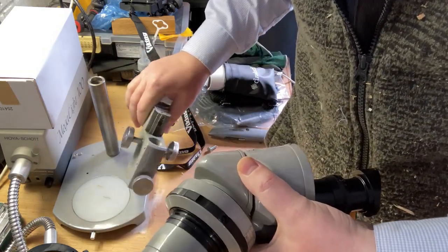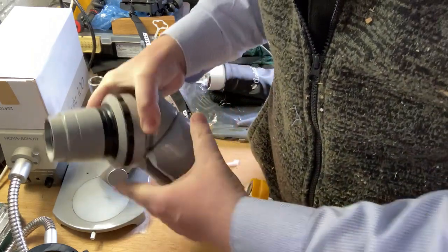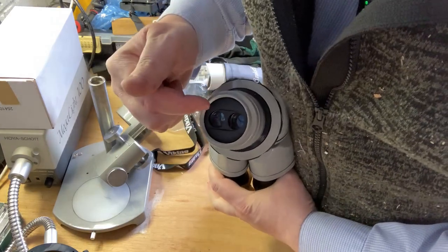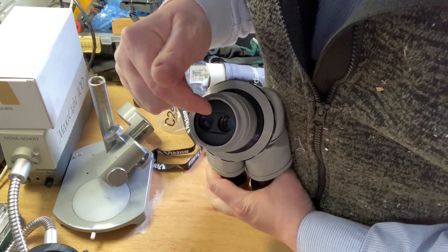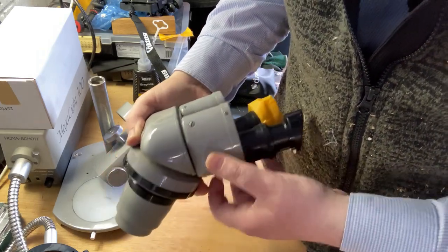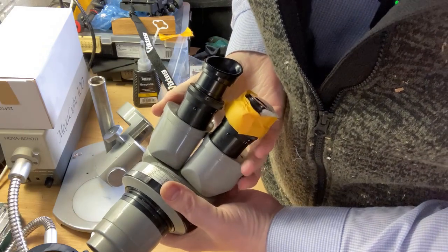Okay. Right. So this is obviously where the eyepieces just slide out. Right, this is where obviously the two binocular signals are coming through. It'll then go up onto this eyepiece part through the optical piece there. You can see that you can actually have an adjustable magnification.